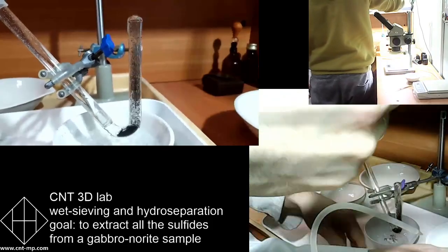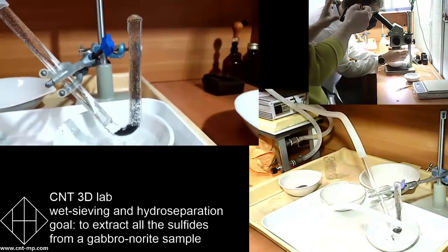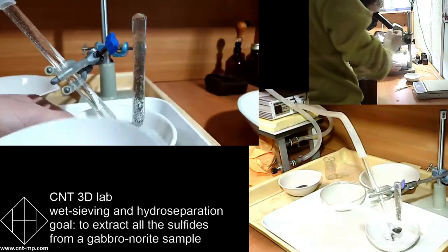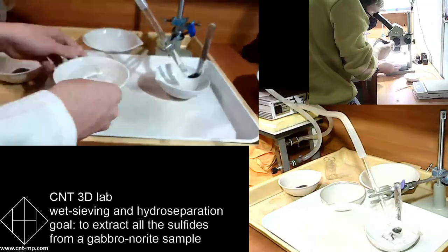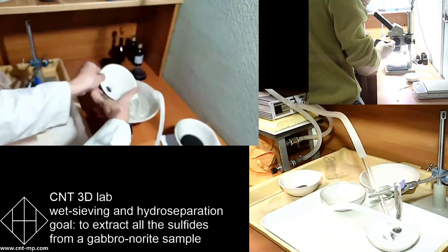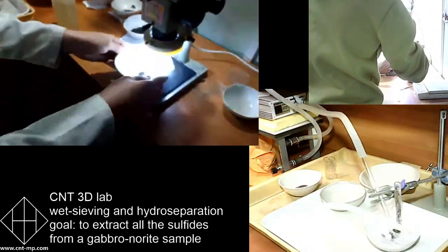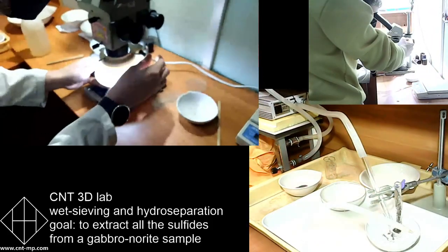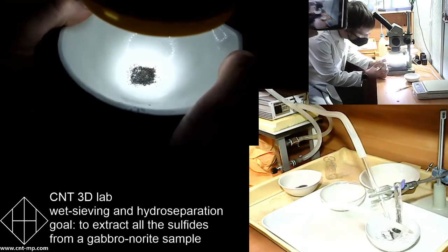Anyway, we're getting back to the hydroseparator. We see that the separator works all right in this short glass separation tube. At the bottom, you can see the mixing of different particles, and some particles go up and the others stay at the bottom. Those which stay at the bottom are heavier, I would say denser, than those that are coming out of the tube.